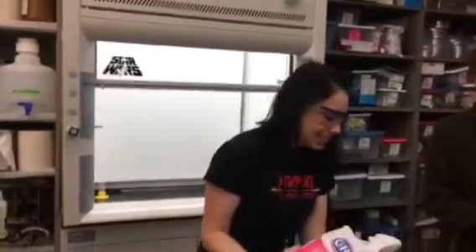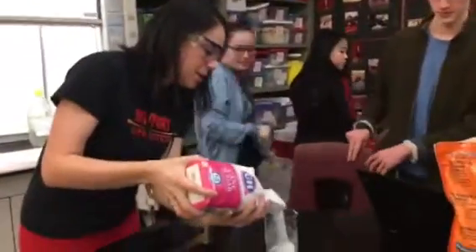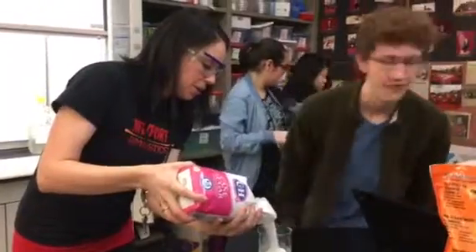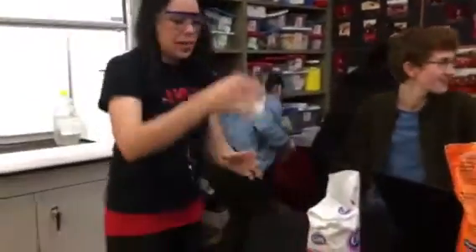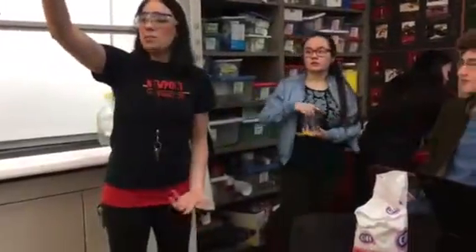When I saw it, I was like, what? Chemistry is the coolest thing in the whole world. So I found an old nasty beaker — you'll see why I chose an old nasty beaker I don't want to reuse. And I'm just putting some regular old sugar in it, okay?